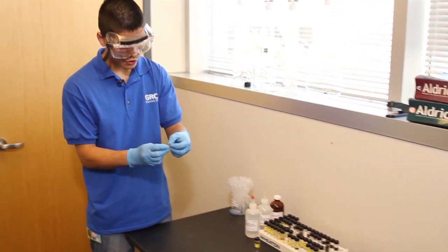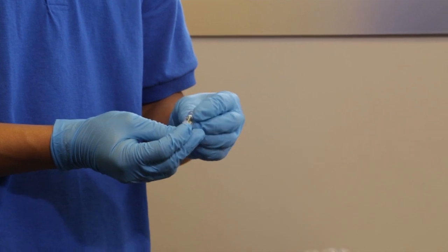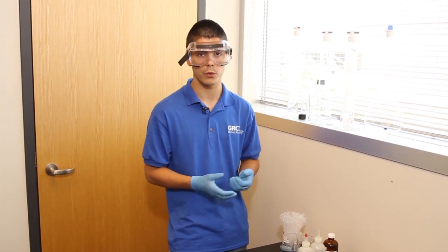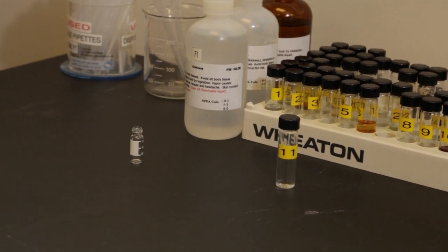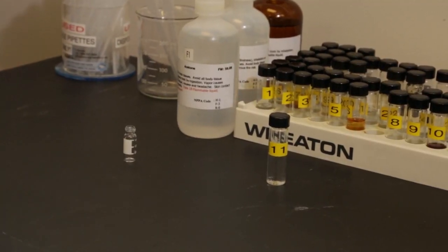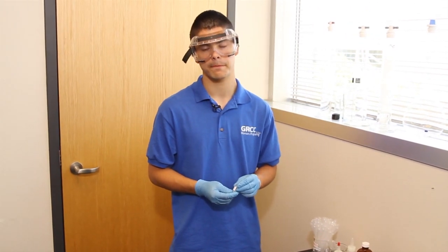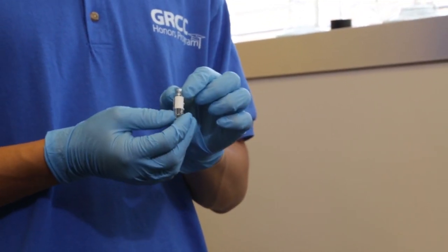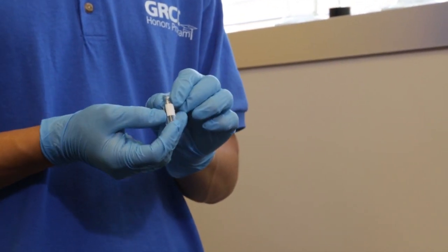The sample goes into one of these little tubes, which have a max capacity of one and a half milliliters. When I do my dilution, I have one of two ways I can do that. The first way is to dilute my sample directly in this vial. The problem is that if you have a super concentrated sample, you might not be able to dilute it enough in this vial. The way to get around that is to use a beaker, dilute your sample in the beaker, and then transfer some of that liquid into this vial. One benefit of GC MassSpec is the small amount of sample you need — you could get away with using just under a mil.